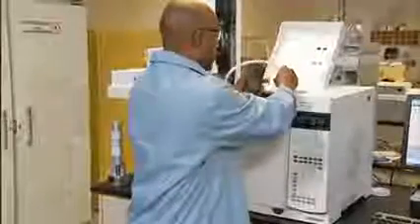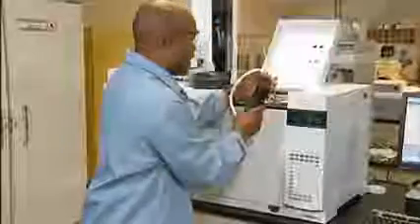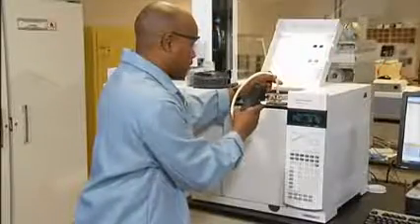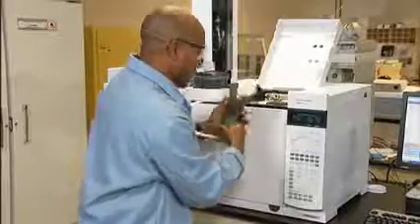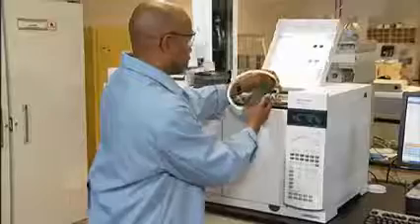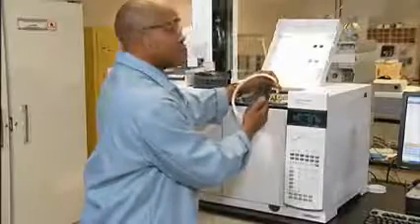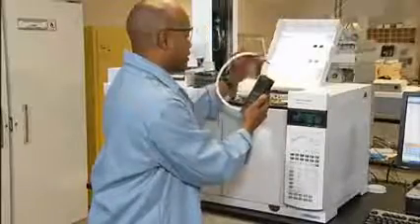At this time, I'm going to check hydrogen flow. So the airflow has been turned off, and I will verify the hydrogen flow. It's what I expected. So now, let's turn off the hydrogen flow, and let's measure the airflow. The airflow is there. This is how we verify our support gases.